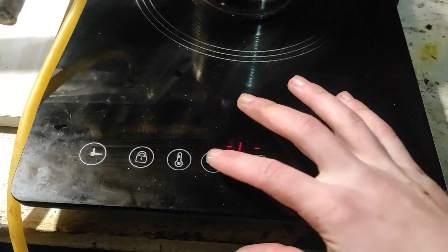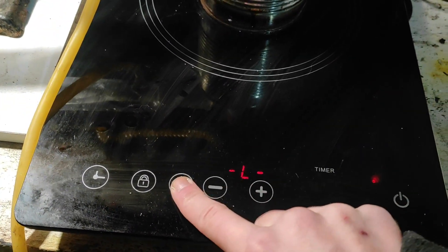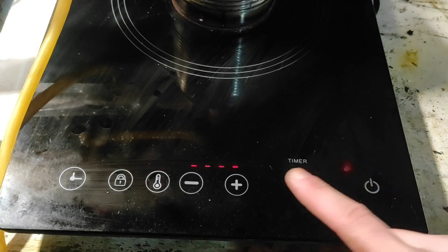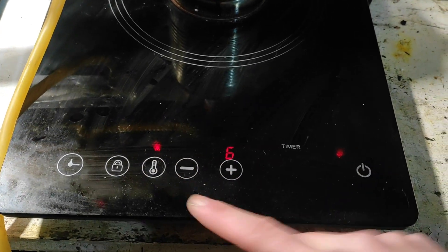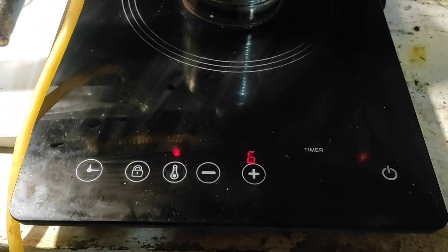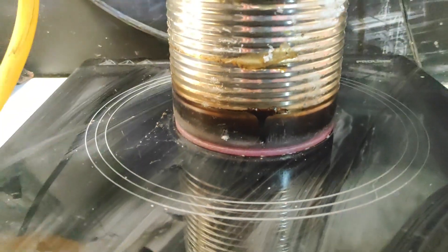So, I don't remember how this thing works, maybe... No, maybe... Okay, then... Alright, and here we can just change the power. As you can see, the decarboxylation produced again a lot of fumes that we don't want to breathe.